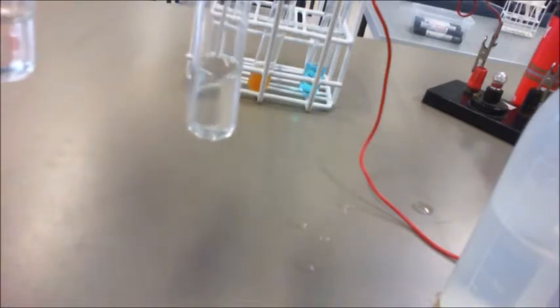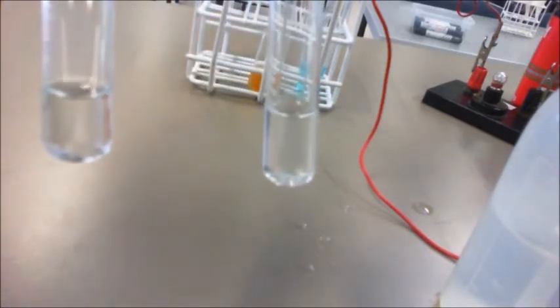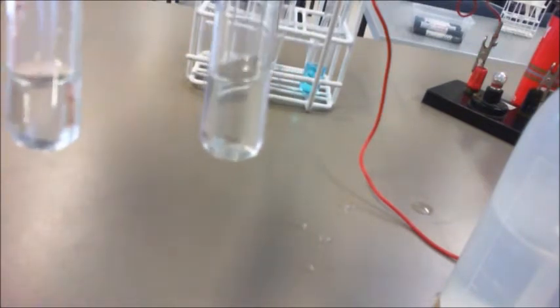So the iron and the copper seem to have high solubility, where the other two, so here's the magnesium, still has a little bit left, and the calcium has now dissolved as well. So this is the magnesium on the left side, and the calcium on the right. So you can see that they have both dissolved, the magnesium not as much as the calcium, but both produce this clear liquid.